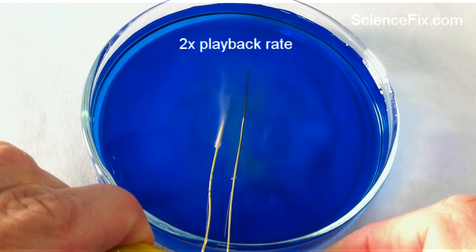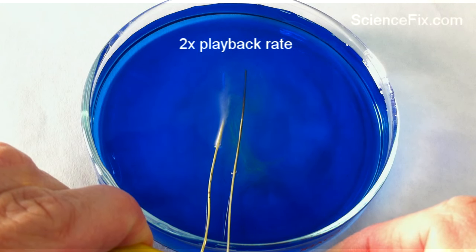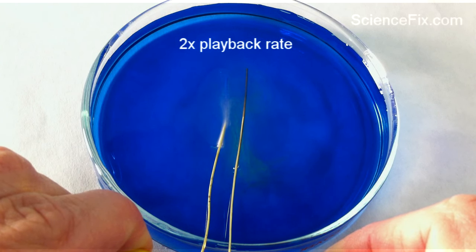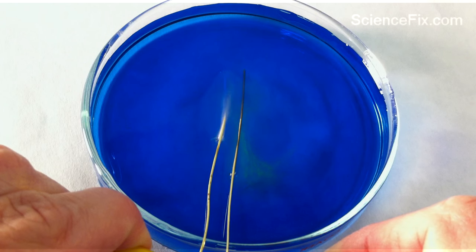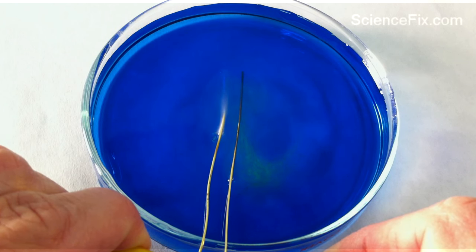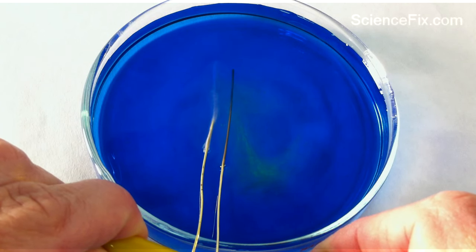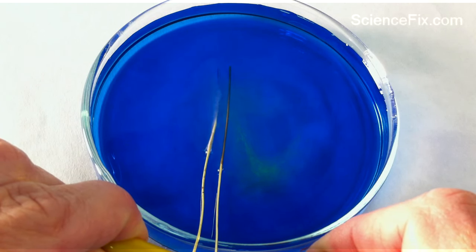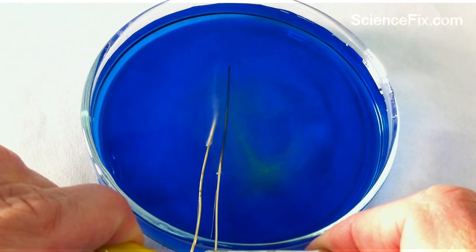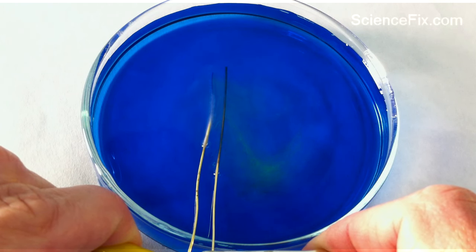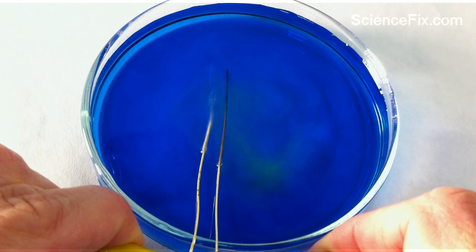Now one of the leads is going to produce a different color. There's going to be a chemical reaction that happens, so the yellow color indicates that hydrogen ions are being produced and that's becoming more acidic. Bromothymol blue solution turns to yellowish and green when there is a higher amount of acid and more hydrogen ions.